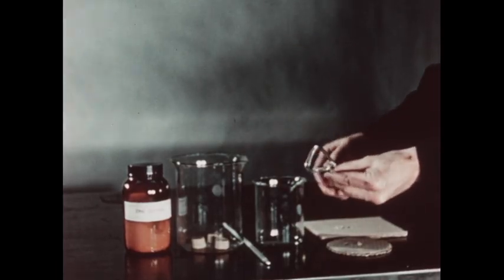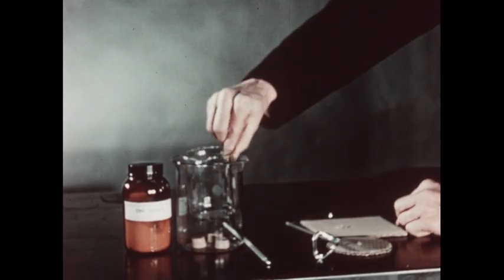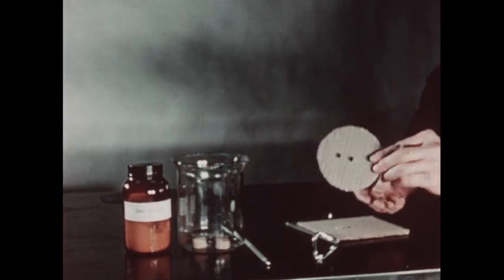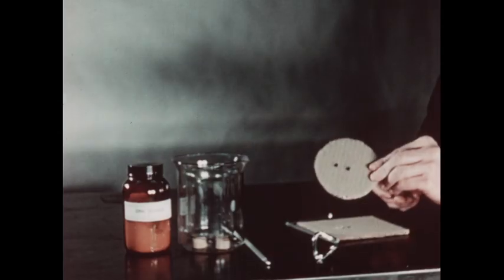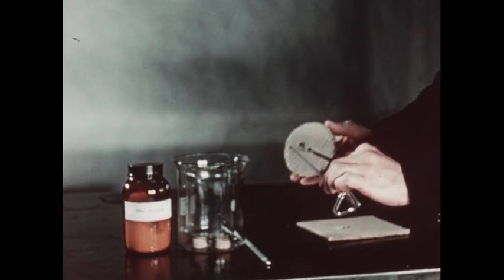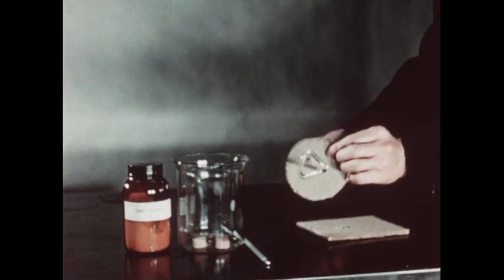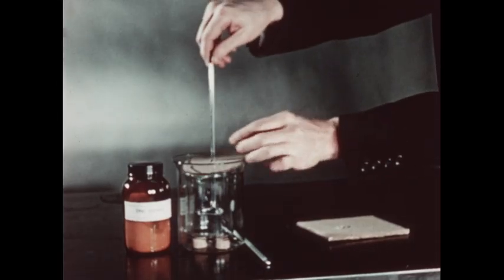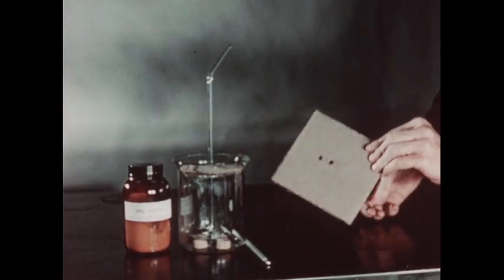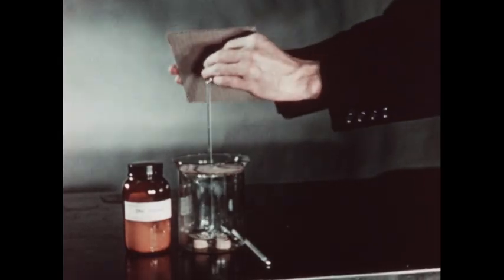The small beaker is now placed in the large beaker. A cardboard disc has been cut to fit into the larger beaker and over the smaller beaker and will serve as a cover. The stirrer will now be inserted through the disc and placed in the small beaker. A second, larger piece of cardboard serves as a cover of the large beaker and will now be inserted on the stirrer.